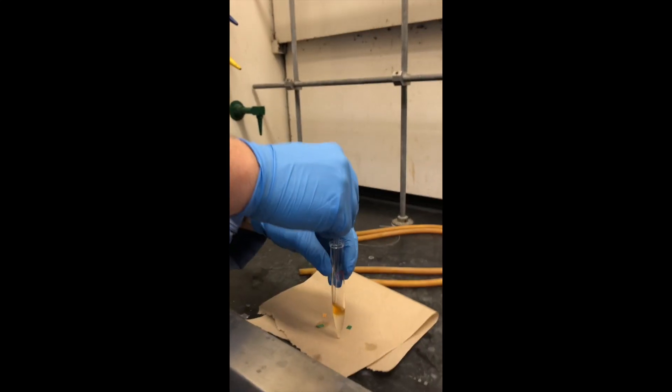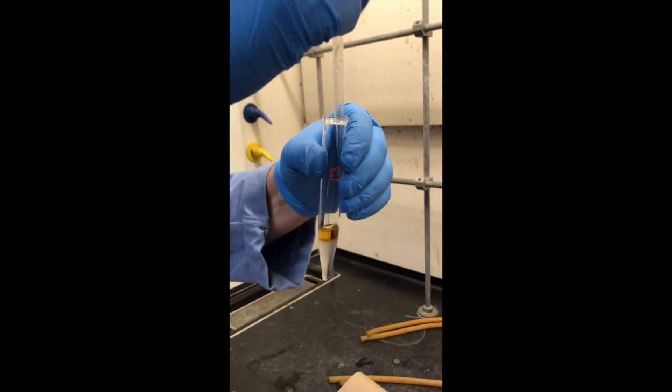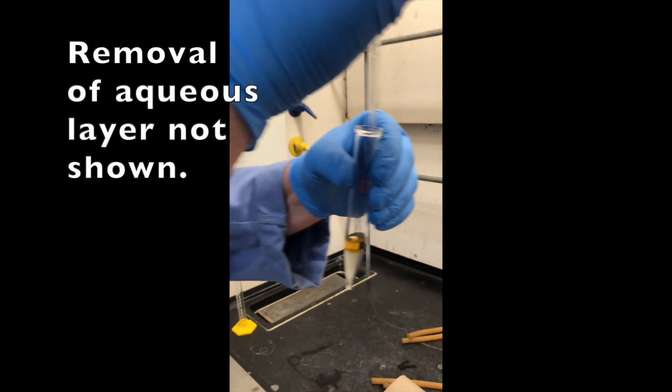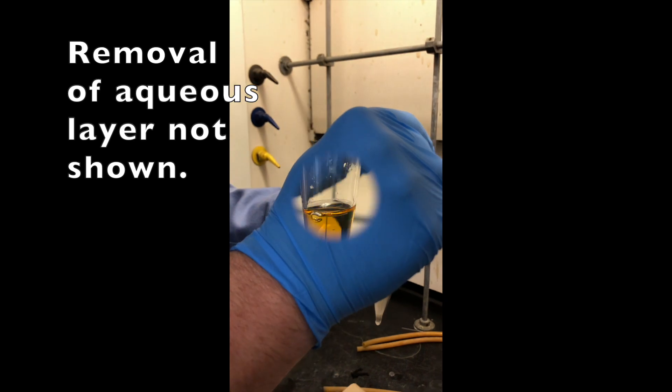That looks a lot cleaner. That's pretty good. So now we'll remove the lower layer. And we're not going to video the tedious removal of the lower layer because you've now seen this.